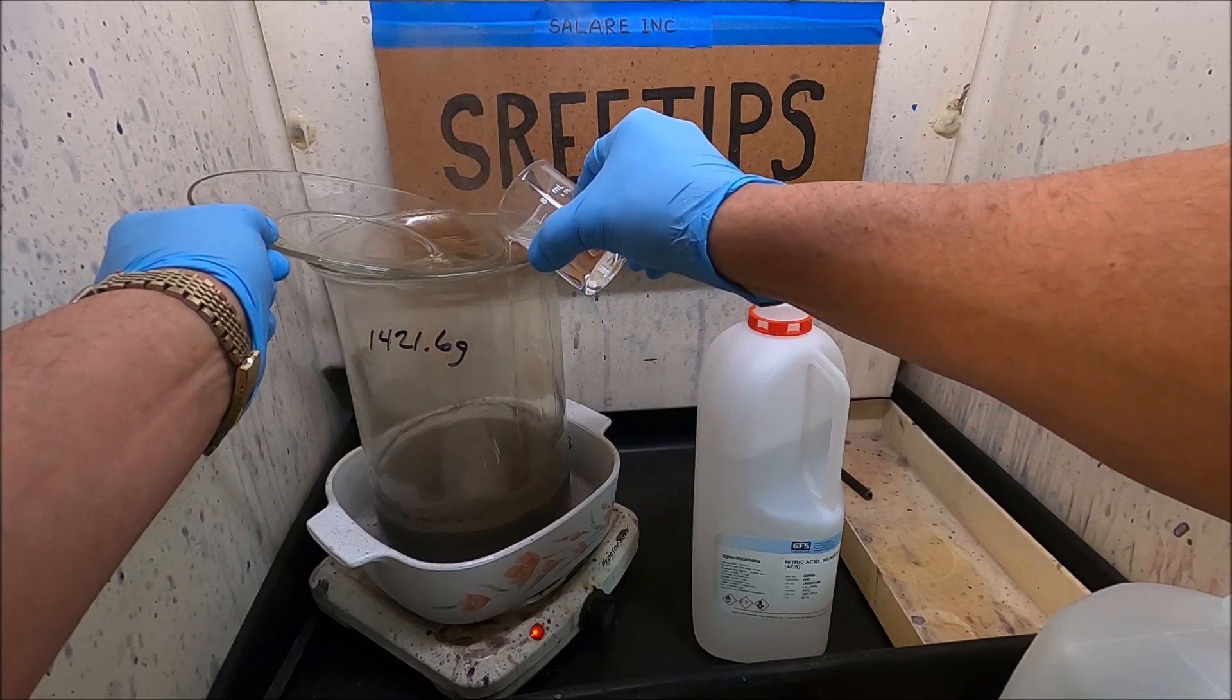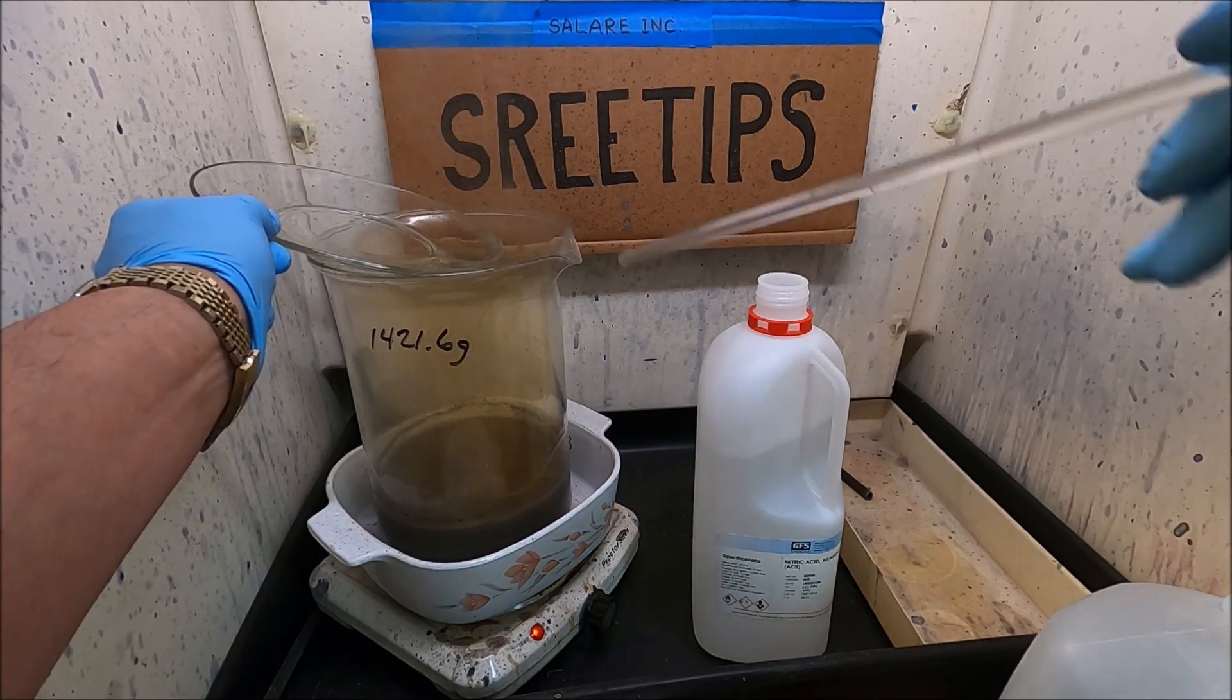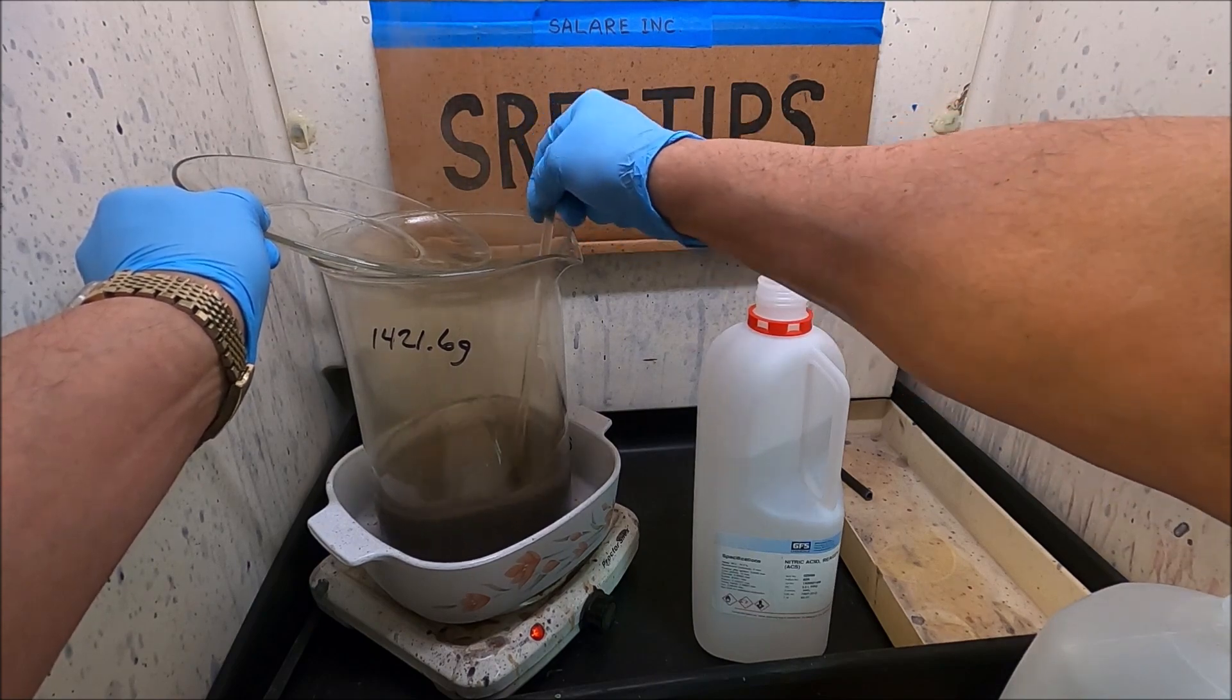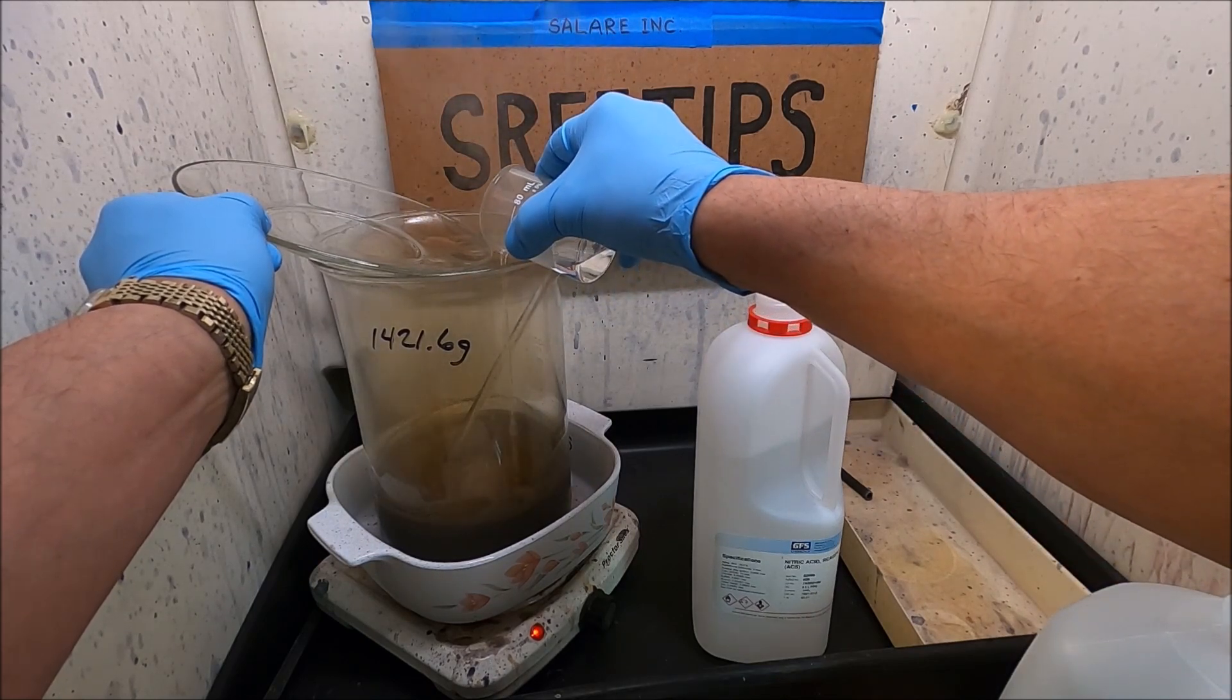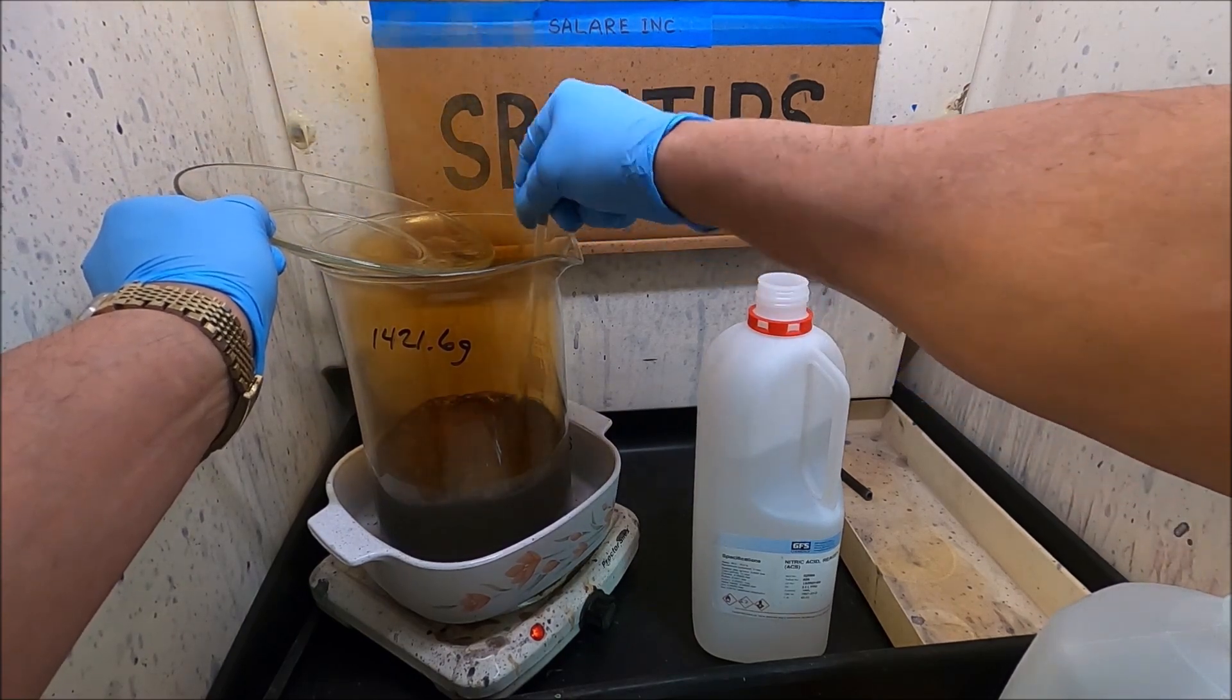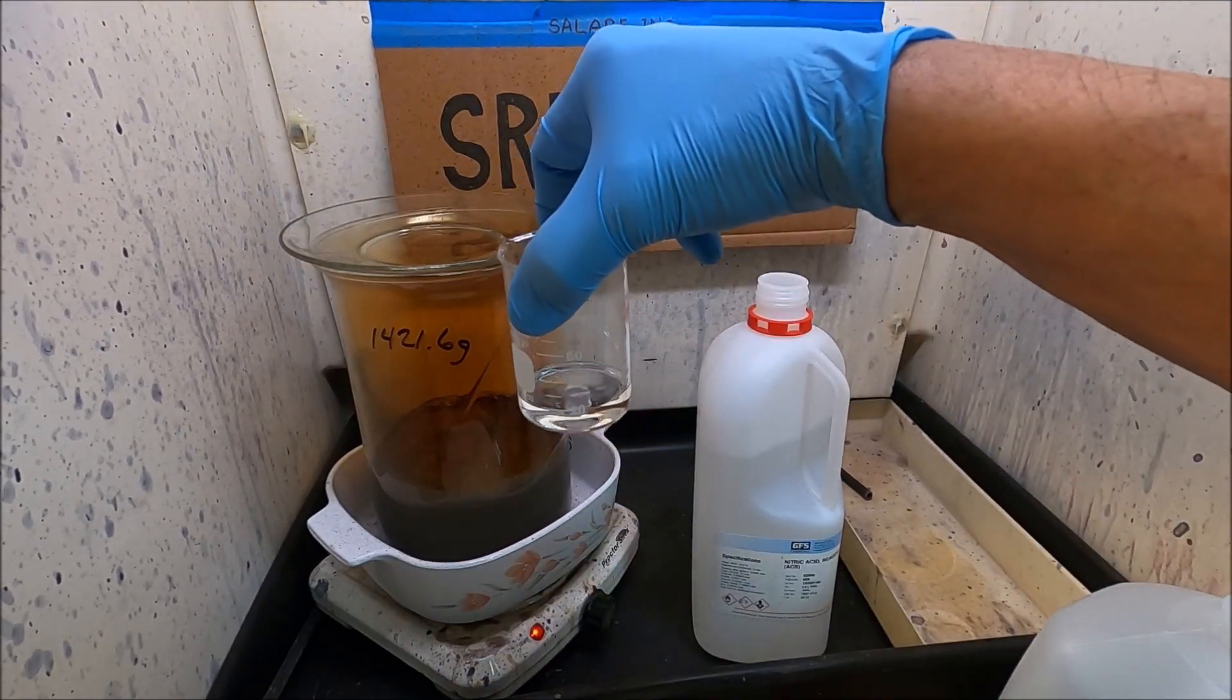Pour this in slowly. Not too bad. Pour the rest in. Got it ready to fizz up a little bit, just hold off until we add the rest of it. Got most of it in there, only about 20 milliliters left in the beaker.